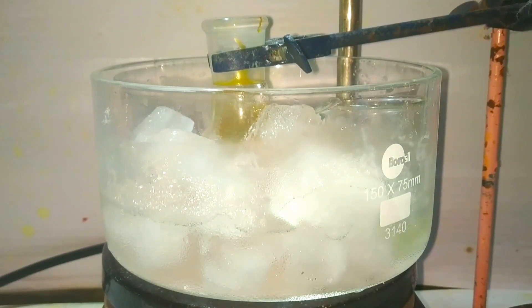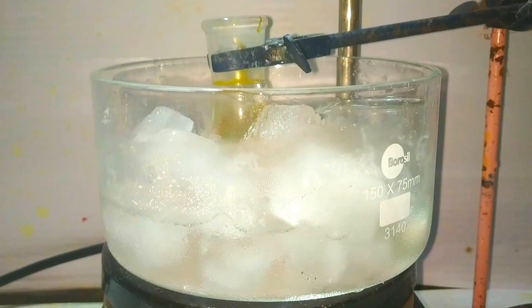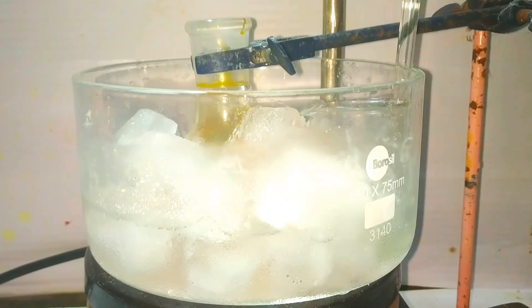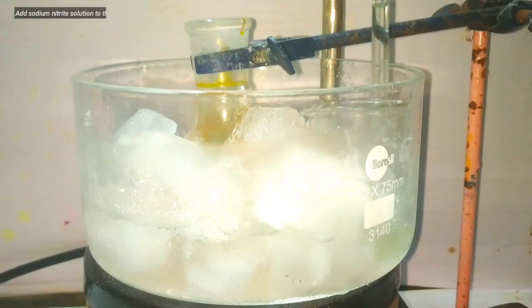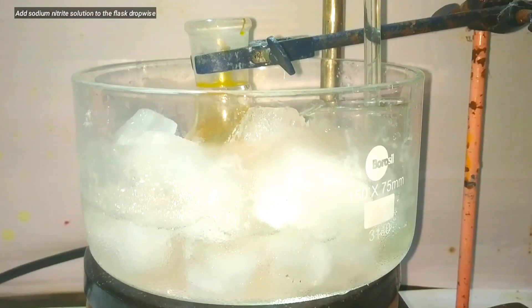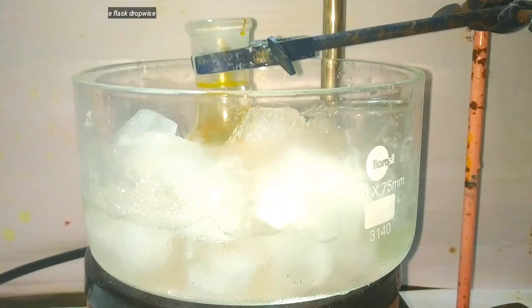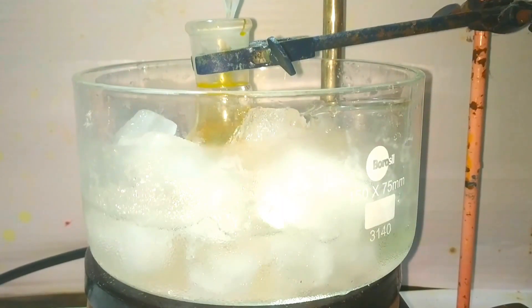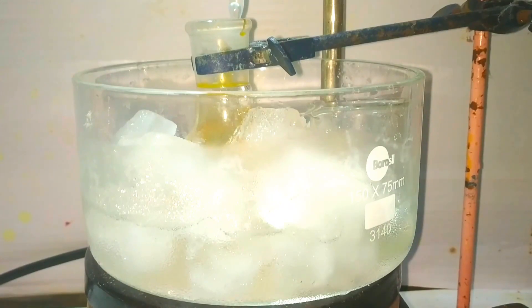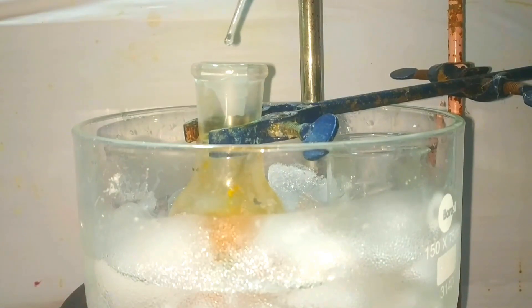Once we confirm the temperature has gone below 10 degrees Celsius, we can start to slowly add the sodium nitrite solution into the round bottom flask. I am using a glass dropper to add the sodium nitrite solution drop by drop, because this reaction can elevate the temperature and our aim is not to go above 10 degrees Celsius. Add it very slowly.